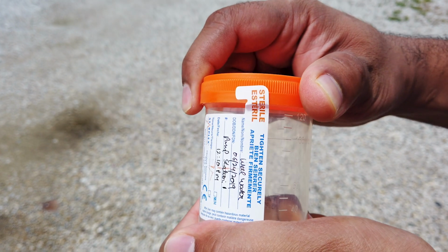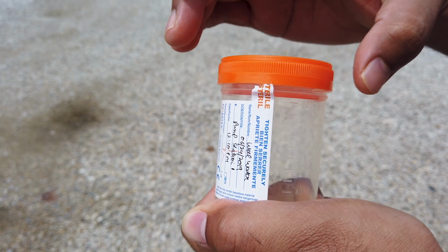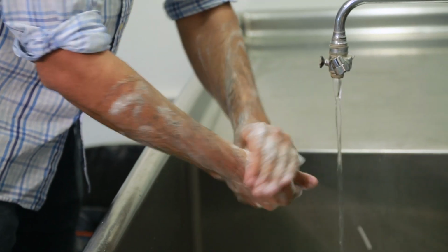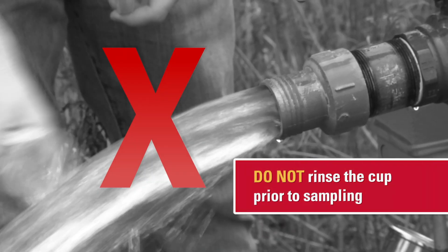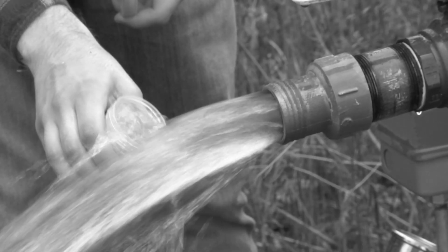The person collecting water samples must use a sterile bottle for all samples and not contaminate the bottle when removing the lid. To start, sample collectors must wash their hands thoroughly with soap and water. Gloves may be used but are not required. Do not rinse the cups prior to sampling. This could introduce microorganisms which do not represent the source of water being sampled.